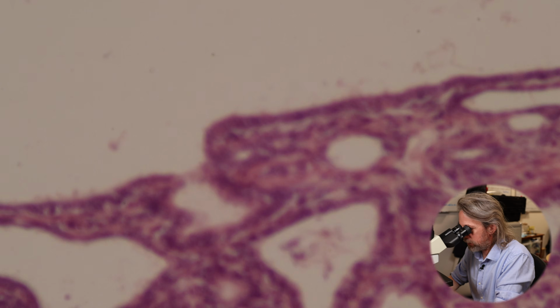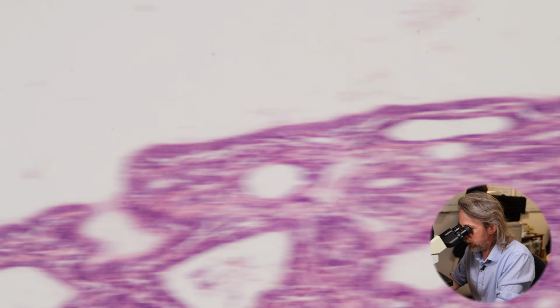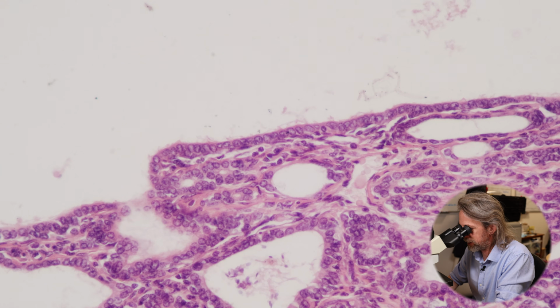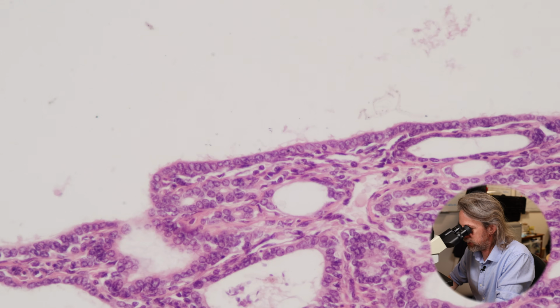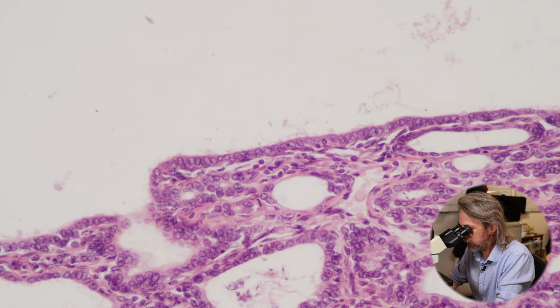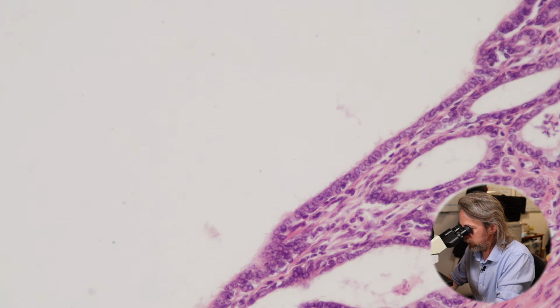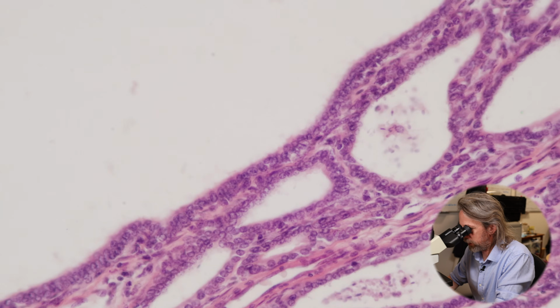So smooth muscle, and then now what sort of epithelium is this? So again, we've got a secretory epithelium. These are the cells making the components of semen. The cells here, they look like they're in a single layer, and they look shorter. This almost looks like a simple cuboidal epithelium. But actually, again, we do have a basal layer of cells and some secretory cells. Now, if we look elsewhere, do these cells get any taller, I wonder? They look quite cuboidal, don't they?